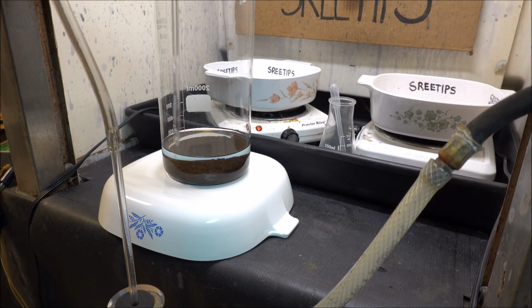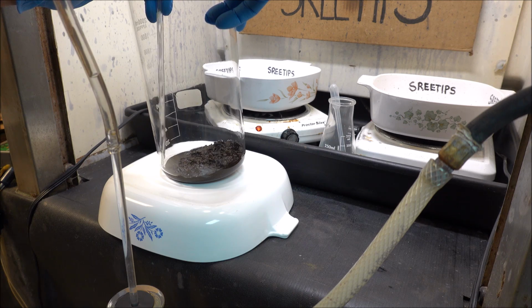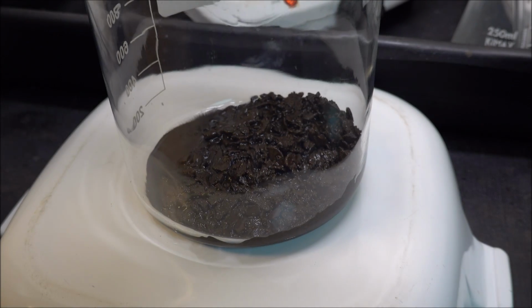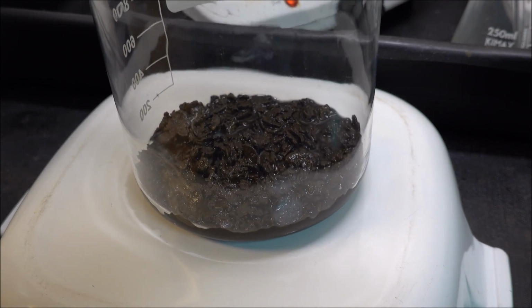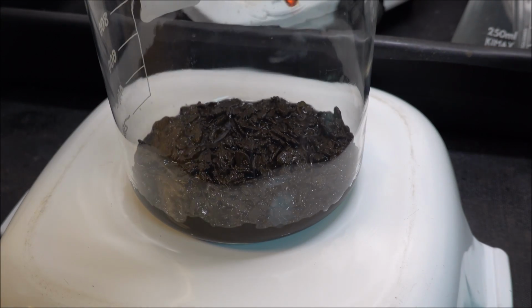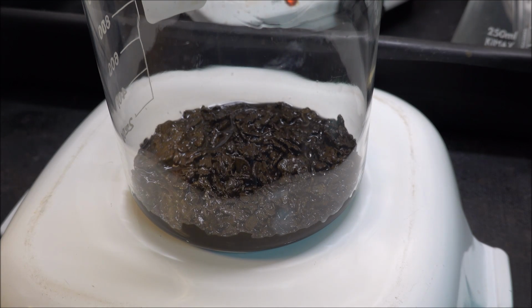All right, here we go. We're going to draw this liquid off with my vacuum tube here. Here's our inquarted gold. Notice how it's formed like a mud in there. And the liquid that's in there with it is going to contain silver. So I want to try to get all that liquid out of there, or at least get the silver rinsed off of these pieces before I add aqua regia.